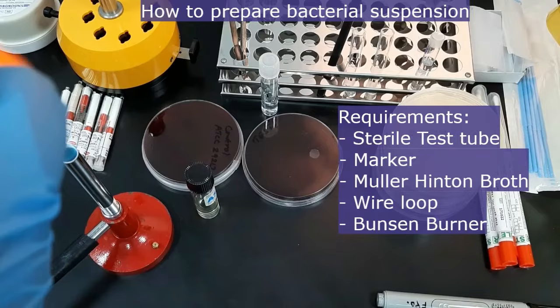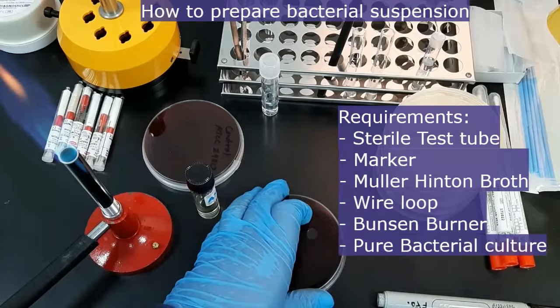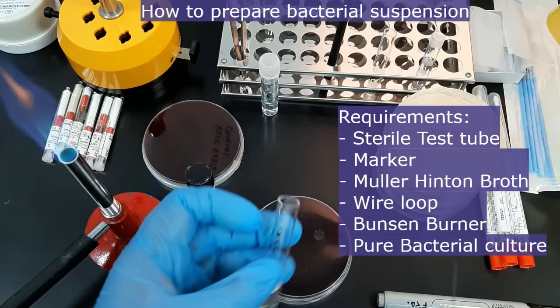Sterilize the wire loop and keep it for cooling. After that, pick the bacterial colonies from the pure culture and transfer them to the test tube containing broth to prepare the bacterial suspension.